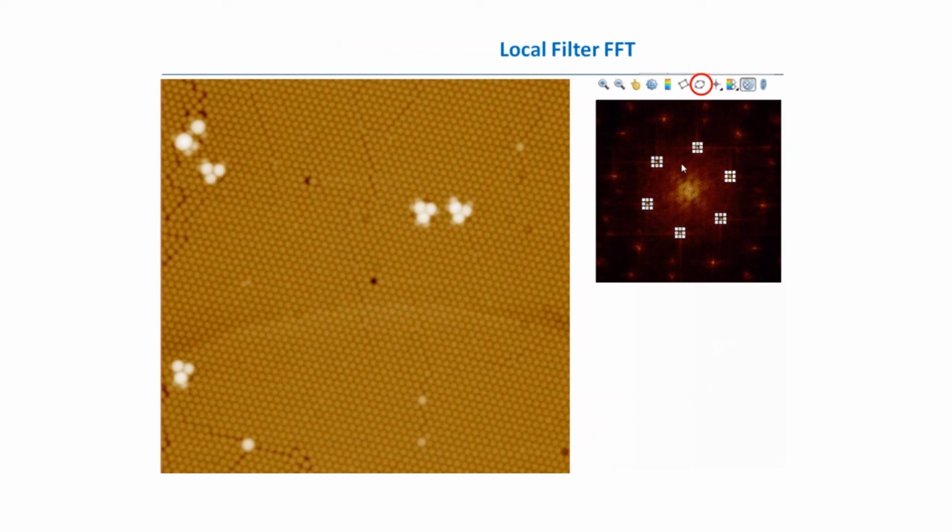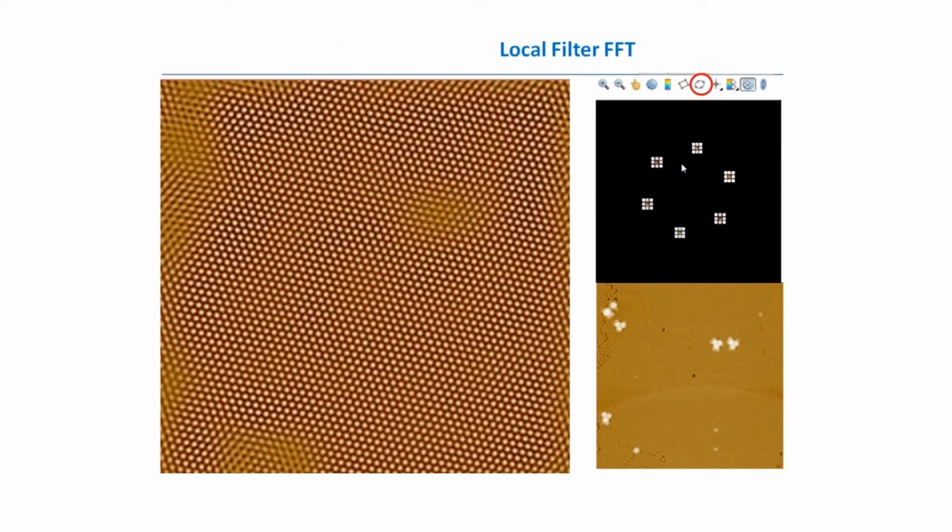When we apply this transform, we will see that the inverse Fourier transform of this dark spectrum, where we left just these main spikes, gives us only the main periodicity. So we see a nice periodic structure. And the difference between them shows us that the periodicity almost disappeared from the main image.